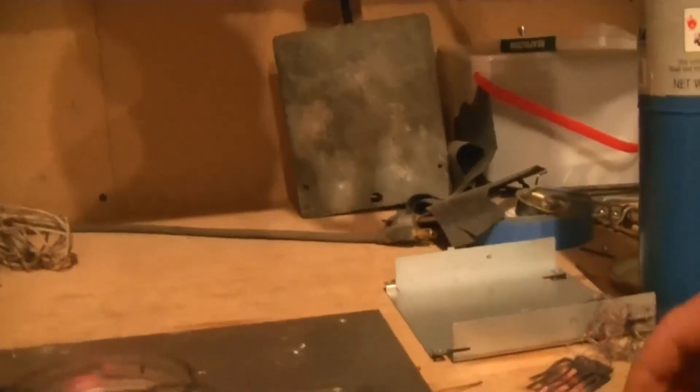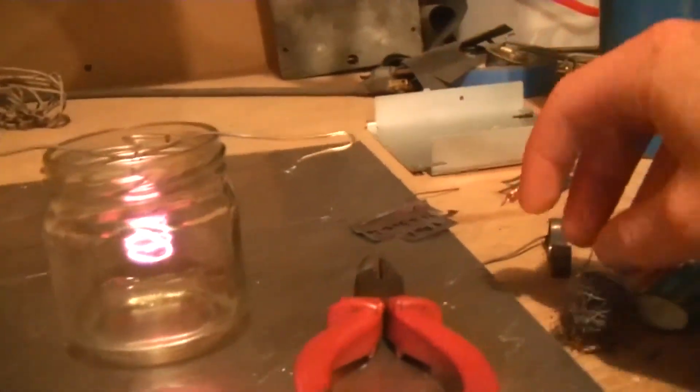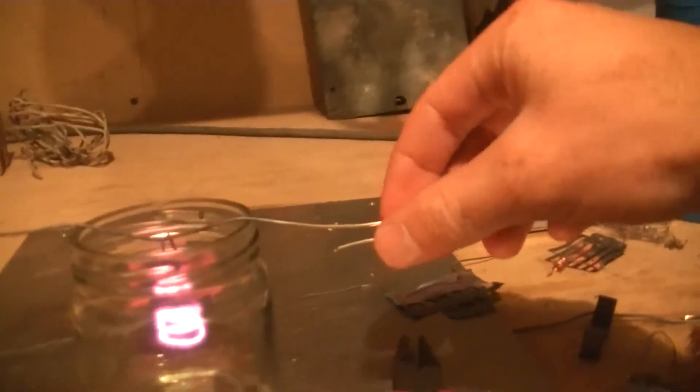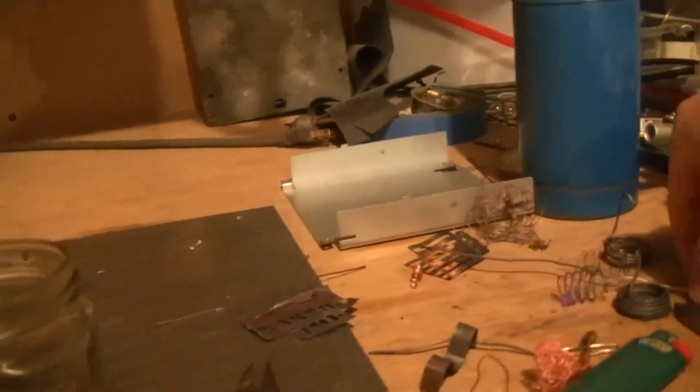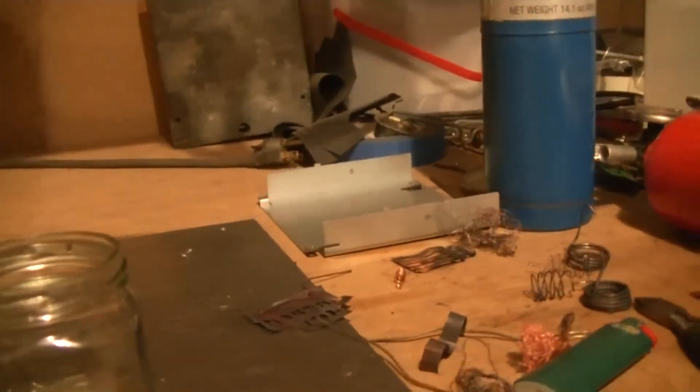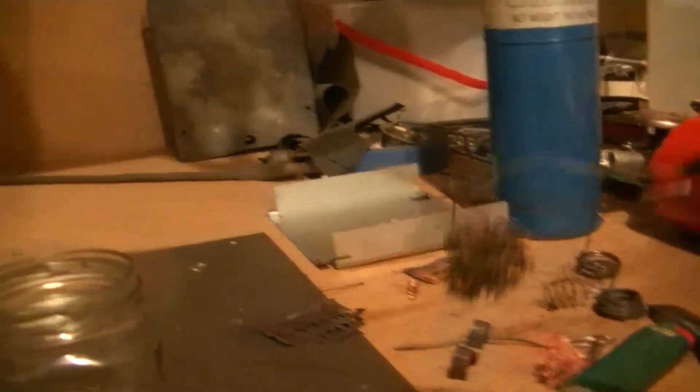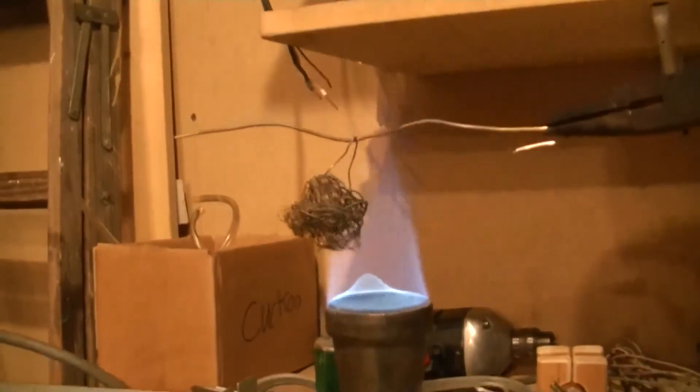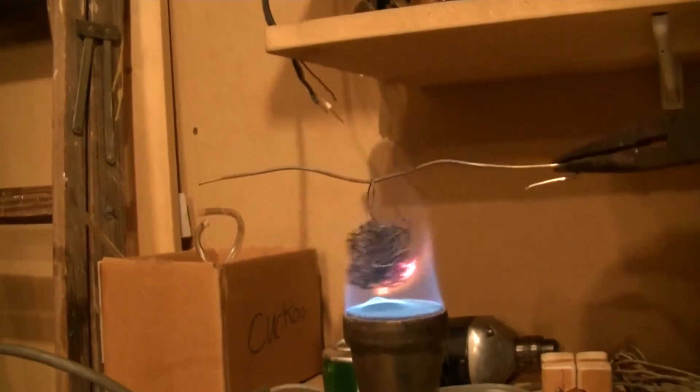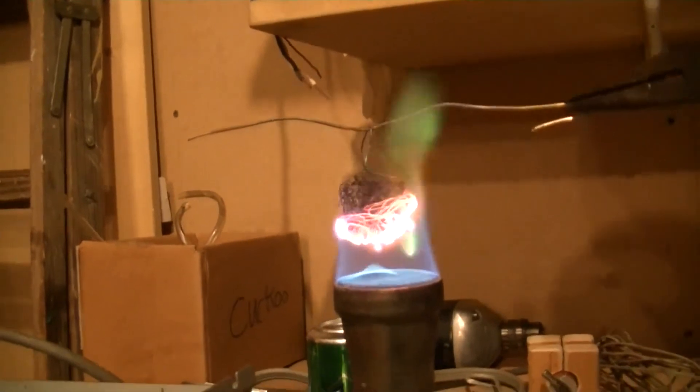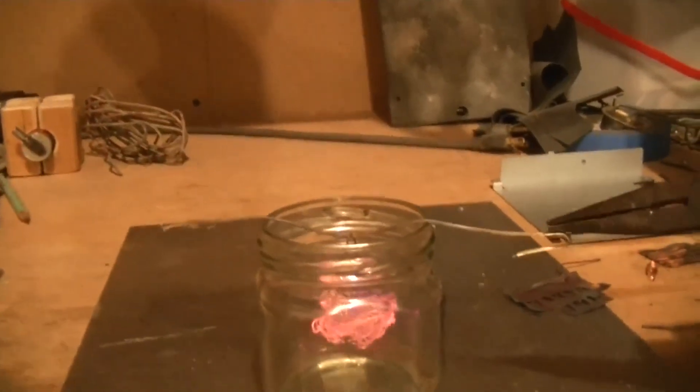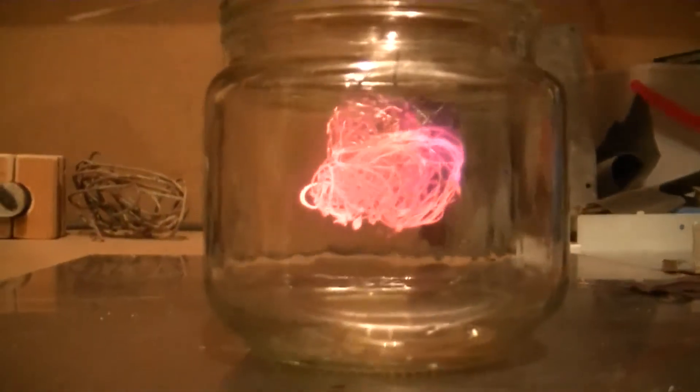But I could try another piece here, just a ball of wire. Let me grab my wires here too, because this is kind of hot. Heat it up over the flame. And after it's glowing real nice, just stick it in there. And it keeps glowing.